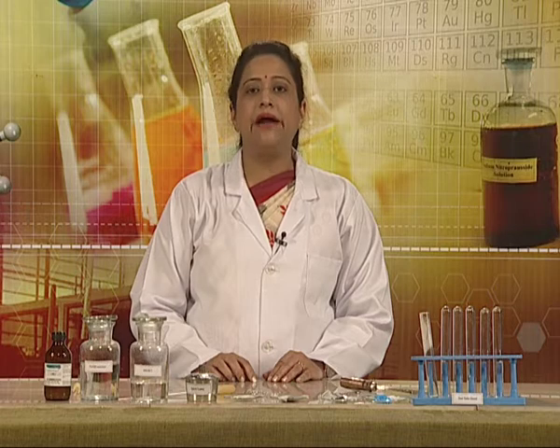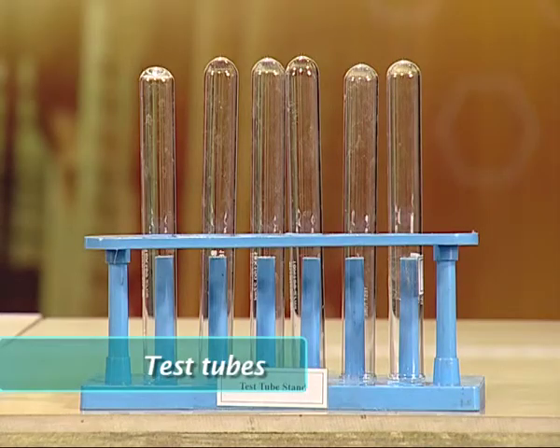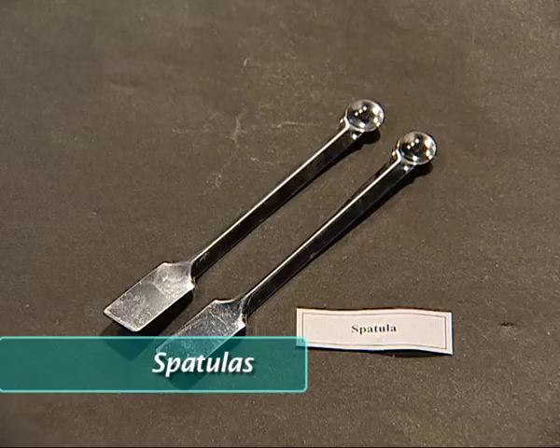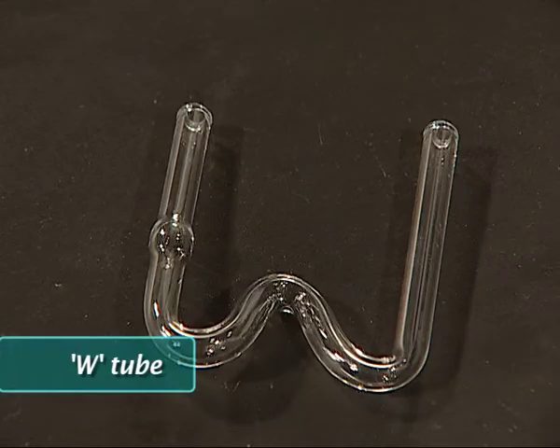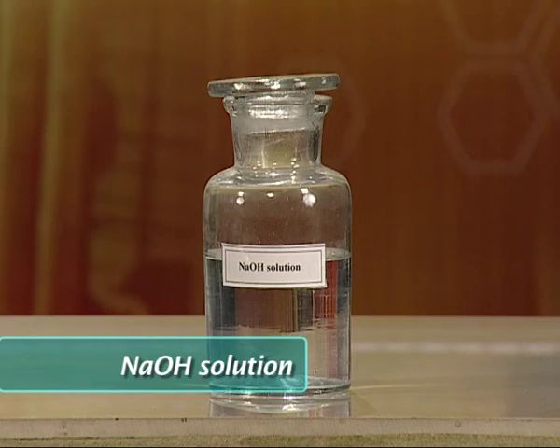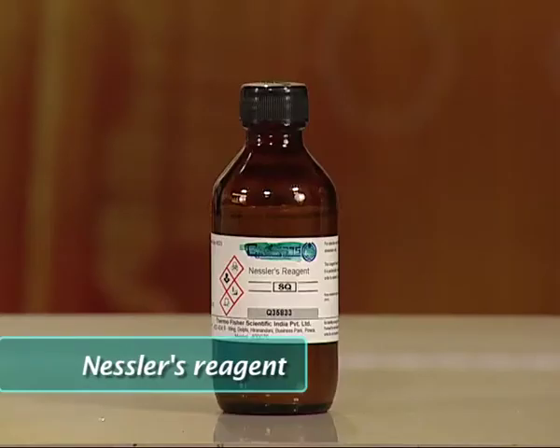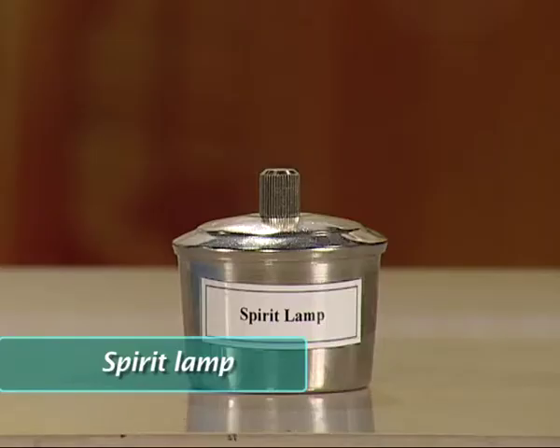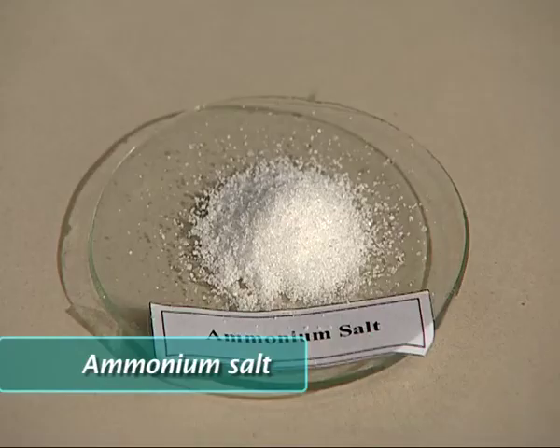For today's experiment, the materials required are as follows: a few test tubes, a test tube holder, a spatula, a glass rod, a W tube, a few droppers, NaOH solution, dilute hydrochloric acid, Nessler's reagent, a spirit lamp, and most importantly, an ammonium salt.